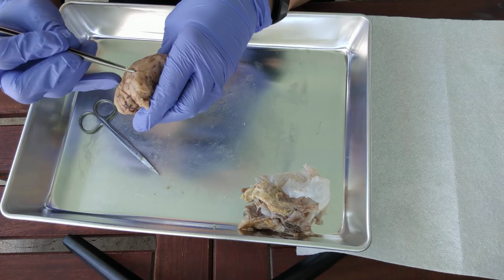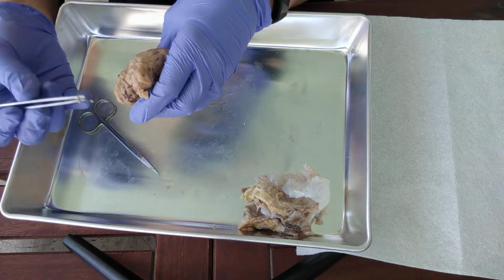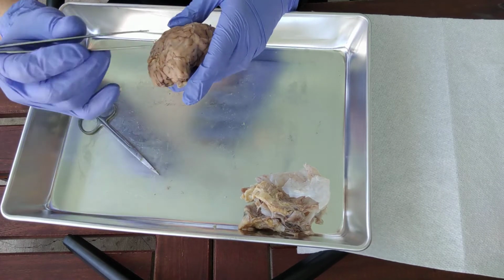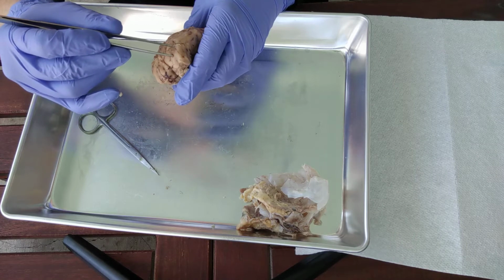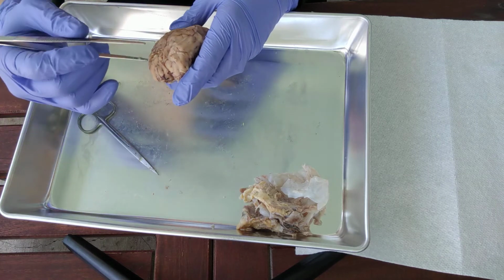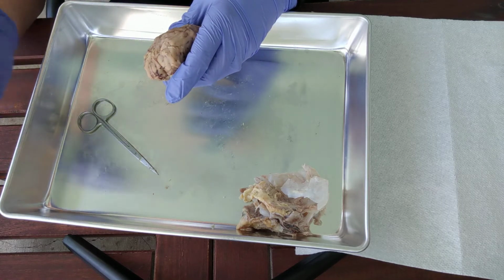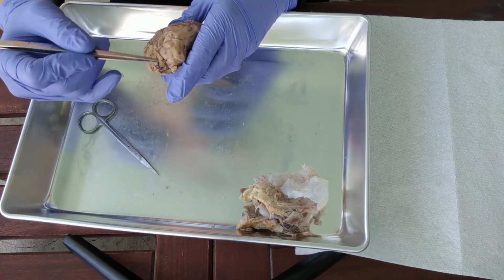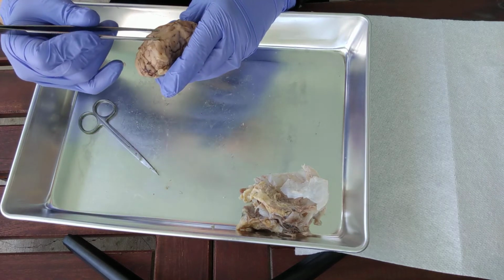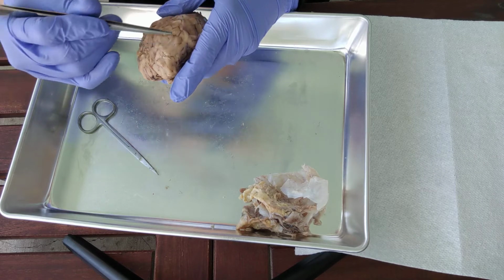So the groove itself is the central sulcus. This one's damaged, but it's right about here. And in front of that, you'll have a gyrus. So if sulci are the grooves, the elevations that are created from those grooves would be gyri, or gyrus if it's singular. So the pre-central gyrus is just going to be the one on the frontal lobe, the gyrus next to the central sulcus, and then the post-central gyrus is the one after the central sulcus, and that would be on the parietal lobe here.